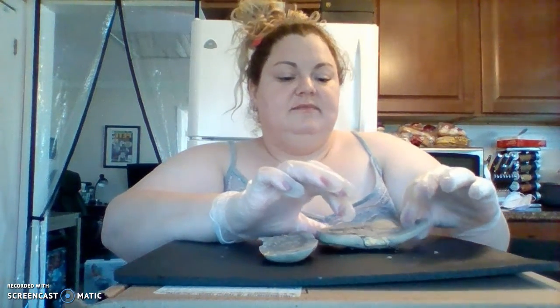And that's about it. Just wrapping that up with the kidney dissection, and thank you.